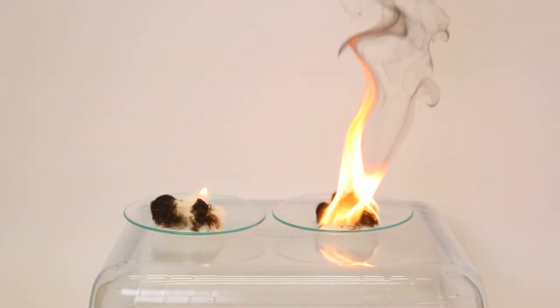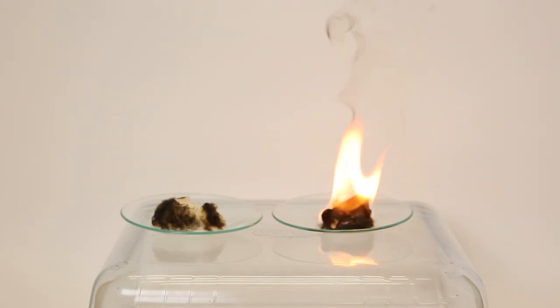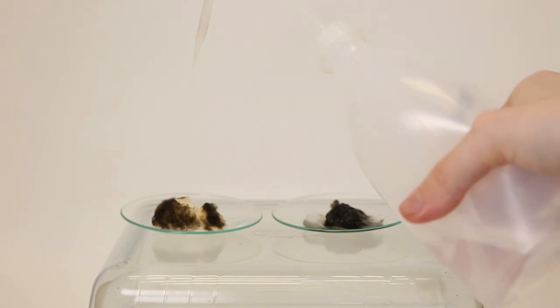The sunflower oil doesn't really want to burn, while the biodiesel easily catches fire and produces a very sooty flame. So after it is basically finished, I just put it out with some water. Normally, don't put water on an oil fire, but now it doesn't really matter.